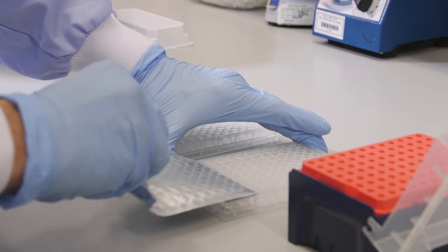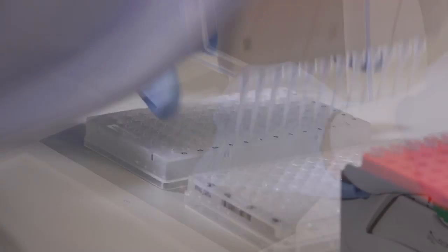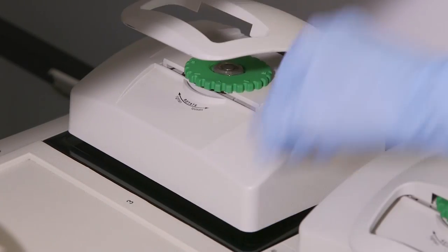Firstly, the oligonucleotides are mixed with template DNA and a PCR reaction is performed.